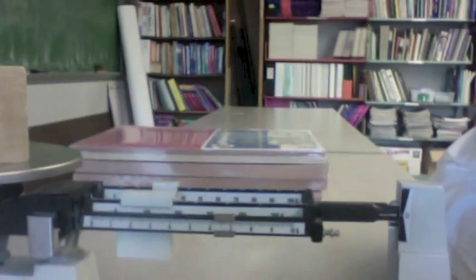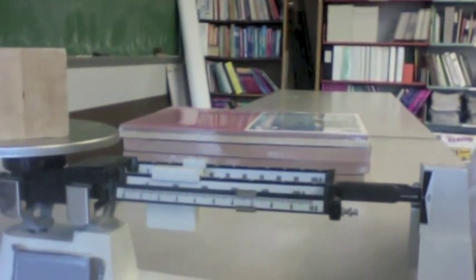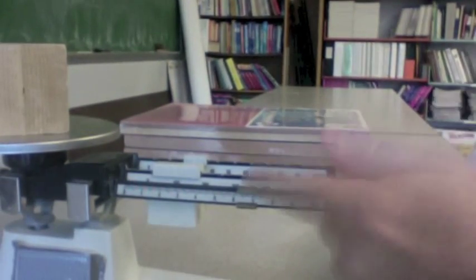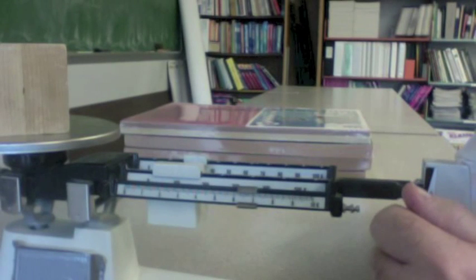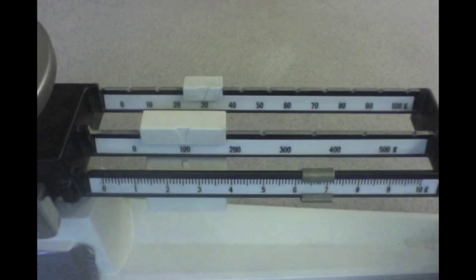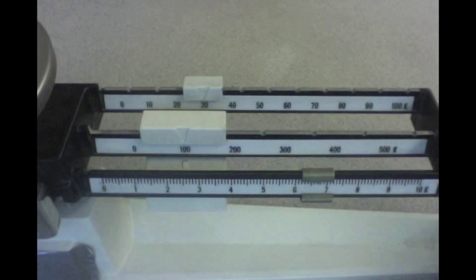And now I can read the mass from the balance, and I can determine what the mass of the block is. We can clearly see that the sliders are at the one hundred thirty and, well, greater than six, but less than seven grams. So right now we're at one hundred thirty-six grams. Let's take a closer look.